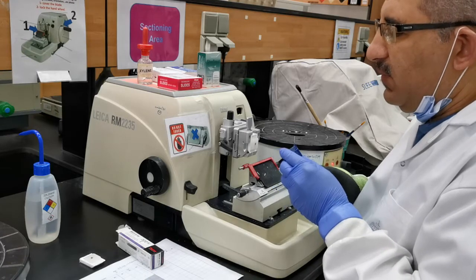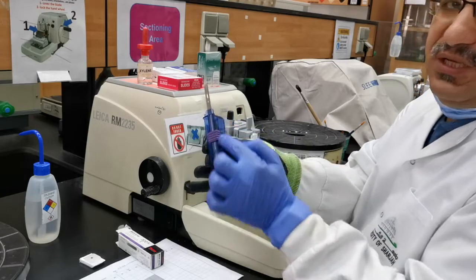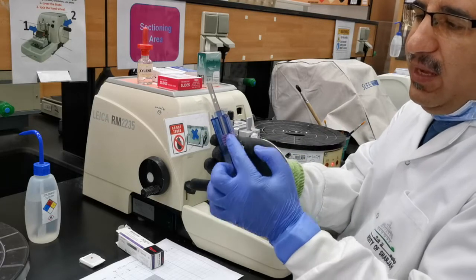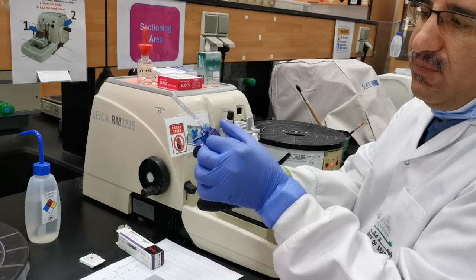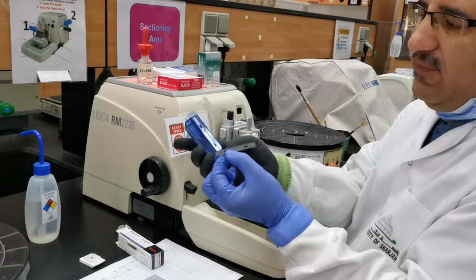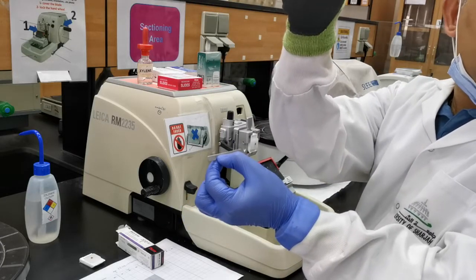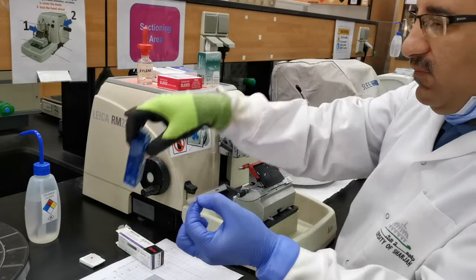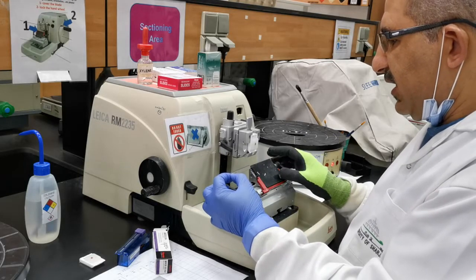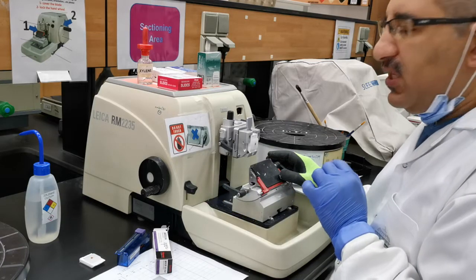Now the block is placed. The next thing is to place the knife. These knives come with a container — please don't handle them yourself; ask the lab instructor to do that for you. You release the knife, get it carefully, and once you finish with it, there is a disposal container here where you place the disposable knives. You don't throw them into the bin — very important. Then with the knife, I place it in its location.